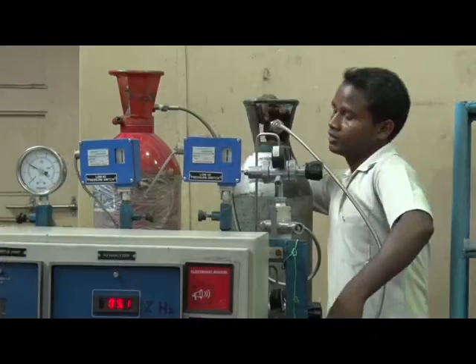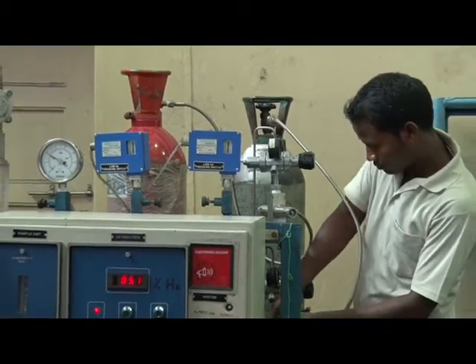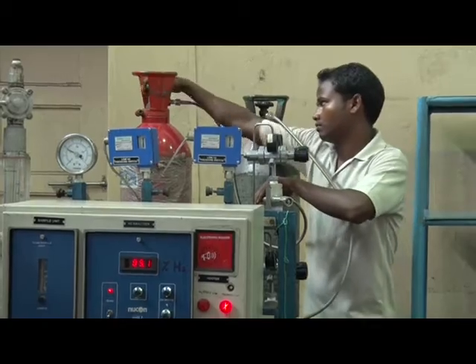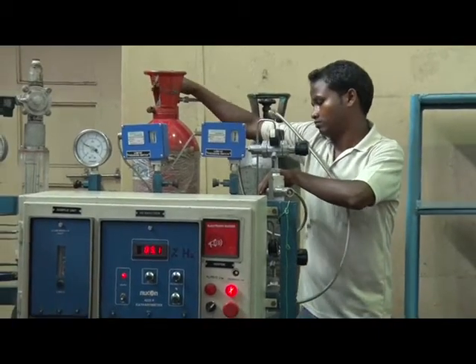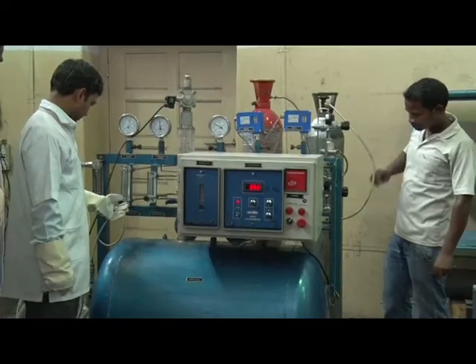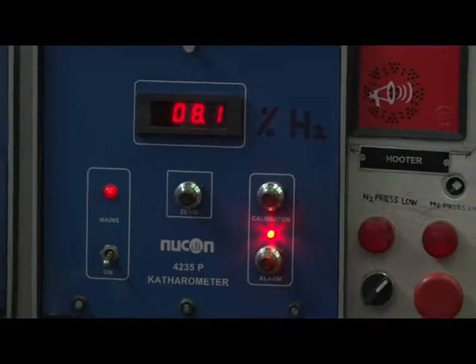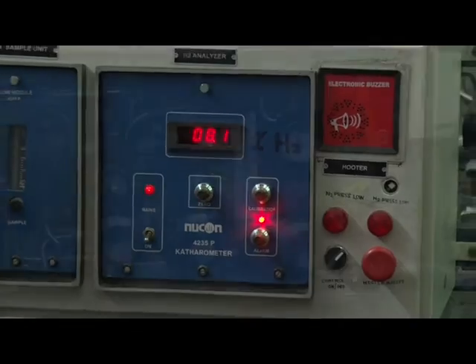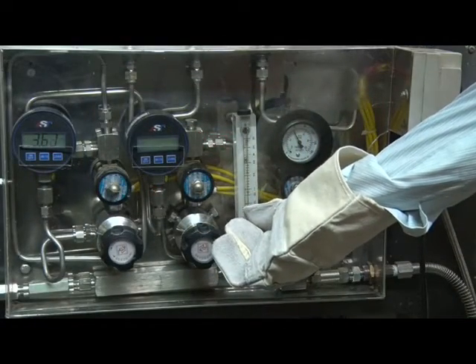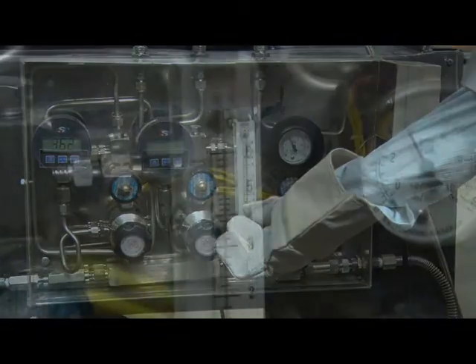You can prepare a hydrogen-nitrogen gas mixture in pre-determined composition in the gas mixing unit. This allows variable dew point control of the annealing atmosphere. Flow controllers help to maintain chamber gas flow rate during the entire annealing process.